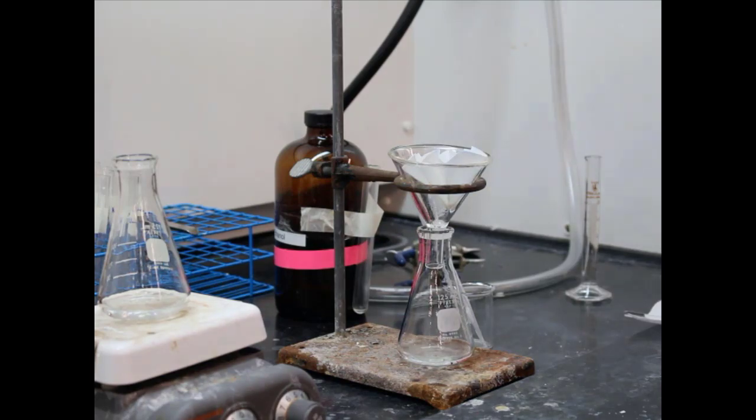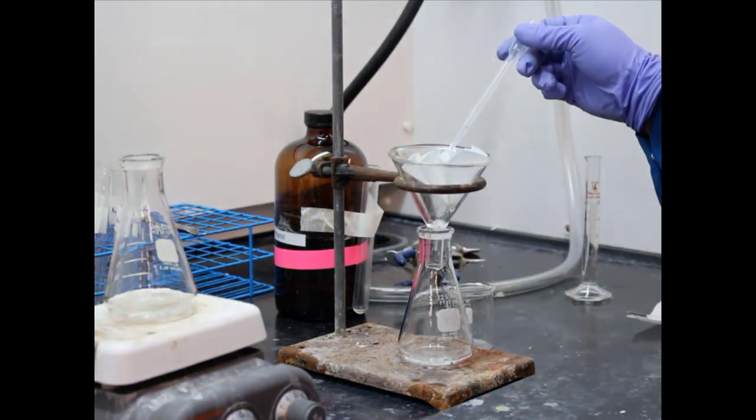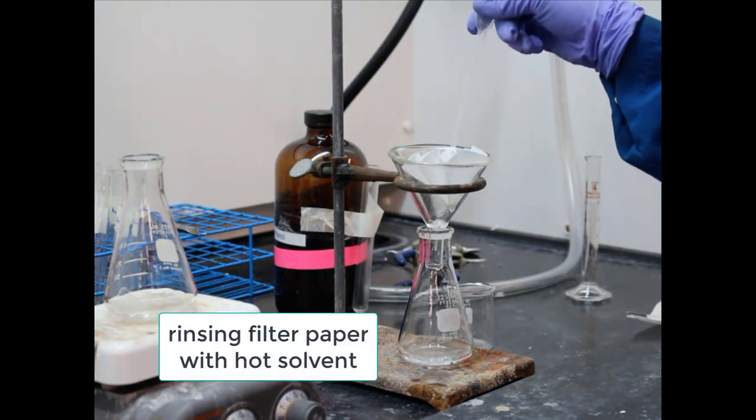All right, and then once it stops dripping, they'll go ahead and take that filtrate at the bottom. That's going to have our dissolved unknown in it. All right. Well, sorry, they've got to rinse it some more too, just in case any got trapped in the filter paper.